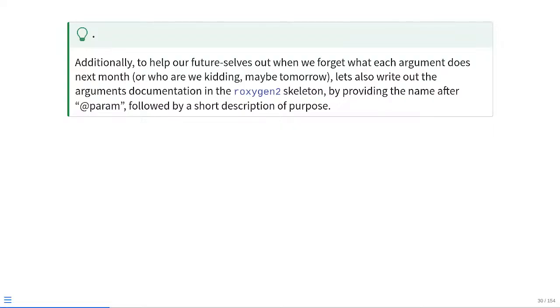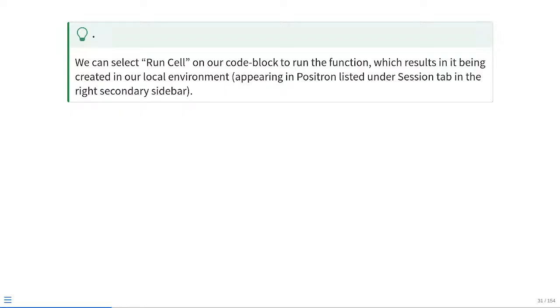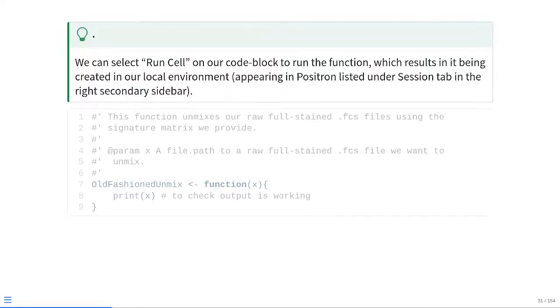So let's go ahead and write out those actual argument documentations within the Roxygen 2 skeleton, providing the name after the @param tag, which allows us to provide the name of the argument and a short description of what it actually does. At that point, if we are creating a function, we just need to go ahead and run the cell code block if we're working within Positron or RStudio, just to create the function in our local environment, which would then appear in the right secondary sidebar right underneath the session tab.